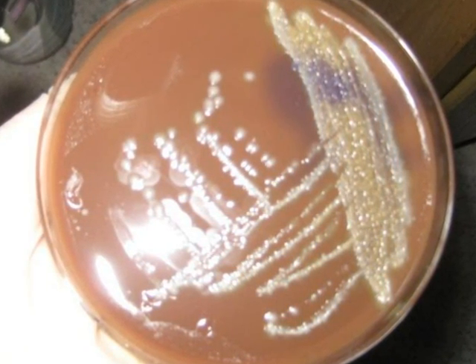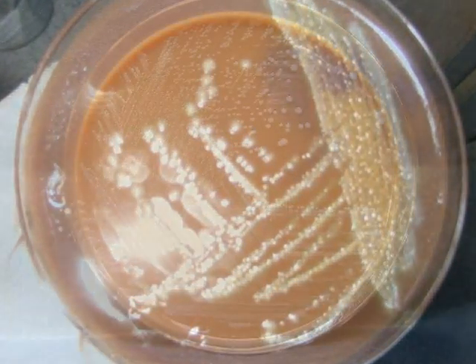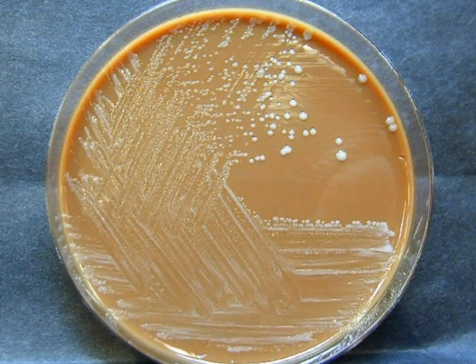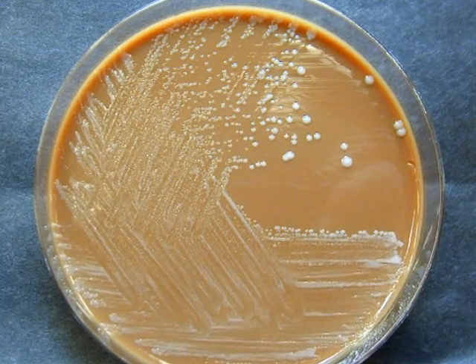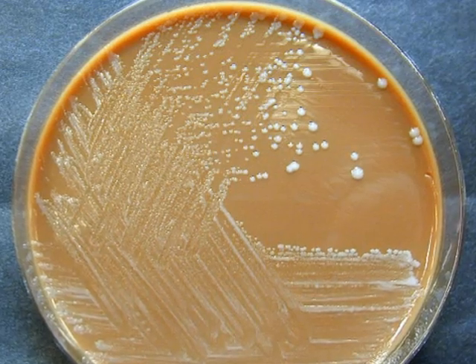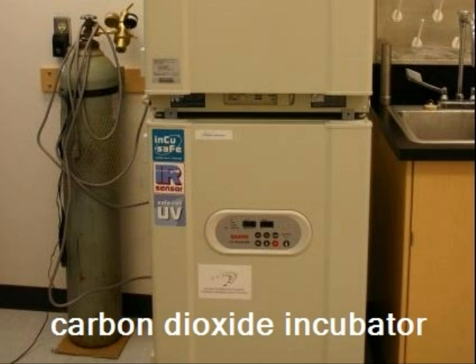Lysing of the red blood cells releases factor X and factor V, which are parts of the hemoglobin molecule. Microbes like Neisseria and Haemophilus, which are normal flora of the throat and nasopharynx, require factor X and V in chocolate agar to grow in the laboratory. These microbes also require high carbon dioxide content. The blood agar and chocolate agar plates inoculated from nasopharynx and throat must be grown under high carbon dioxide to facilitate the growth of Neisseria and Haemophilus, and to encourage the growth of other capnophiles, especially Streptococci, which are normal flora of these sites.